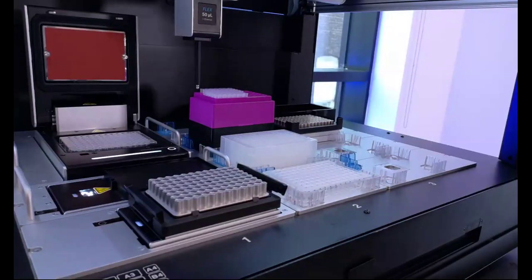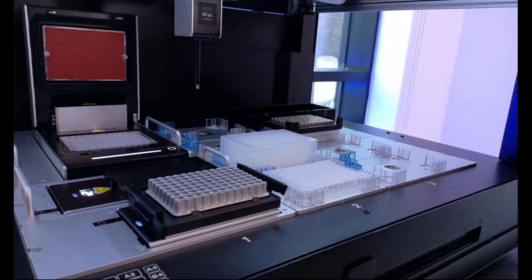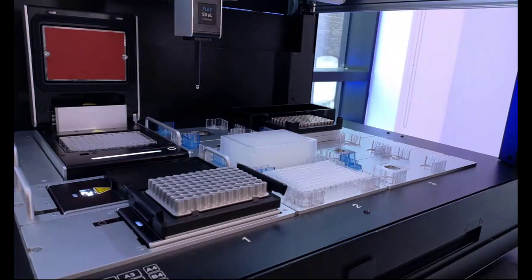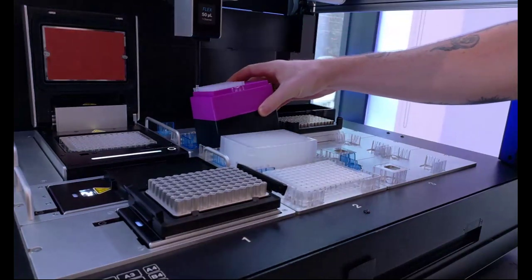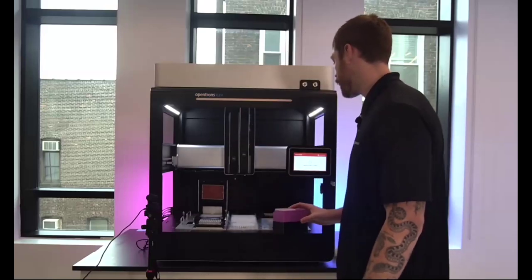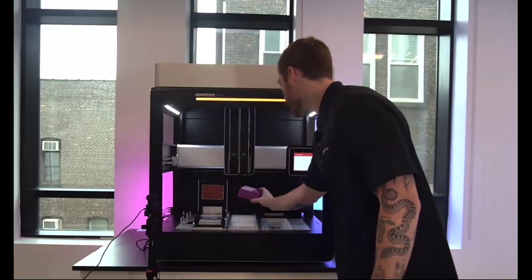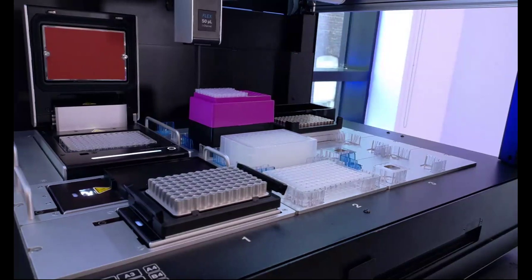Ooh, hey, look, I did not mean to do this at all. I didn't load tips in there. Let's see if I can use my error recovery workflow here to specify the need to retry my step. Would you look at that? It has the ability to pick up tips now.